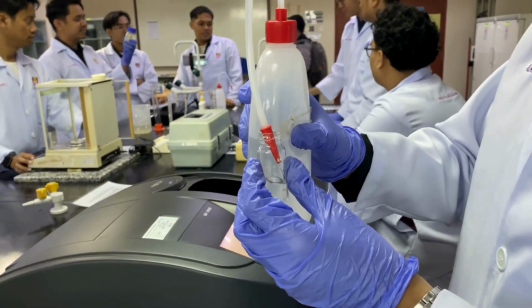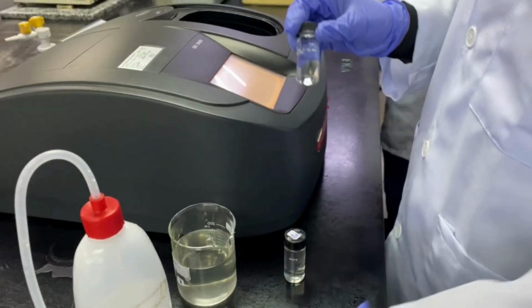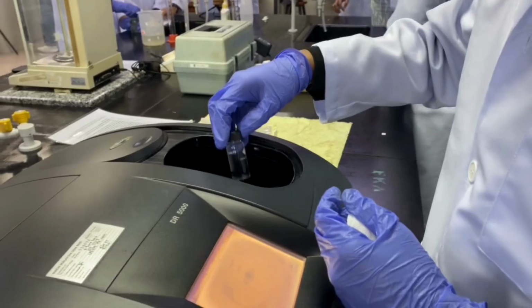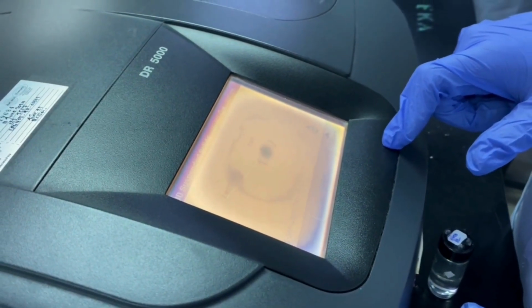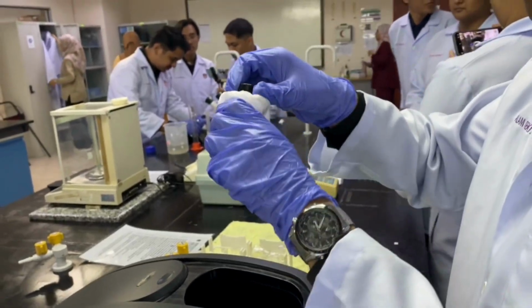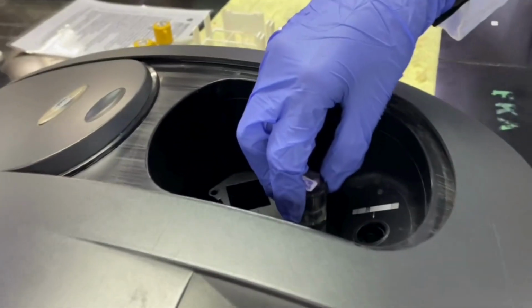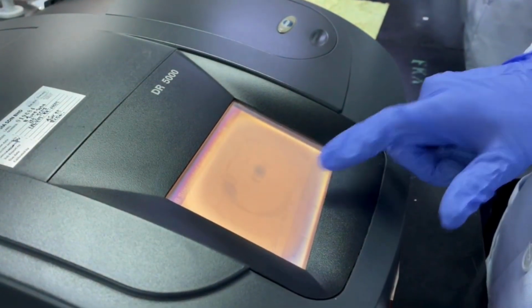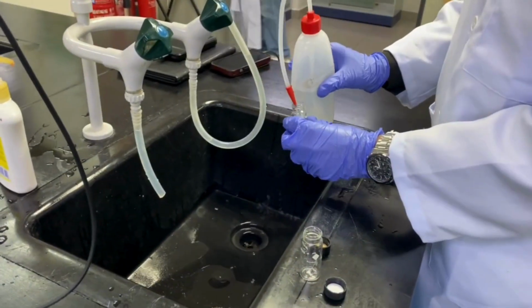For suspended solids, first fill 10 ml of distilled water and sample into sample cells. Wipe the blank sample to remove moisture and fingerprints. Insert the blank sample into the spectrophotometer and press 0. And then wipe the sample cell to avoid error in reading. Insert into the spectrophotometer, press read and take the reading value on the display. After finishing all the experiments, clean all the used apparatus.